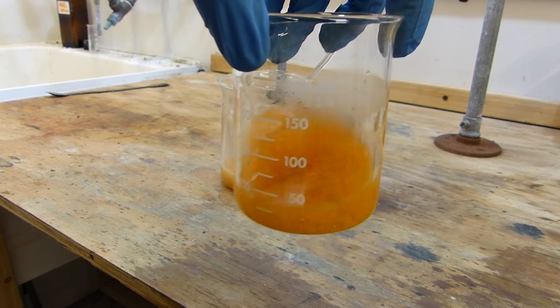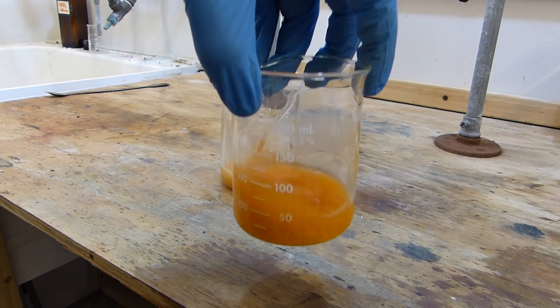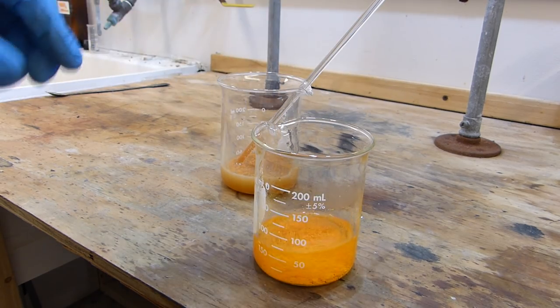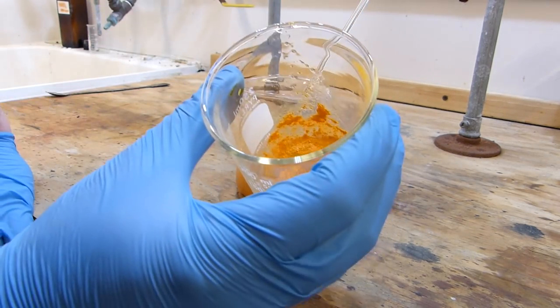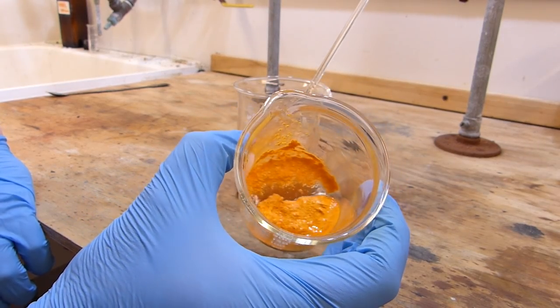So here's the distilled water. I'm just going to wash this really fast, try and get as much of the nitric acid out of it as we can. And there we go, that's our raw material. Now I'll simply scoop this out onto a paper towel to dry.